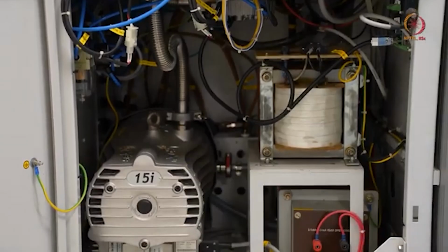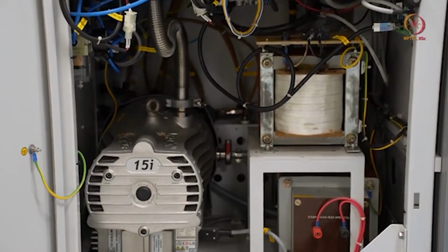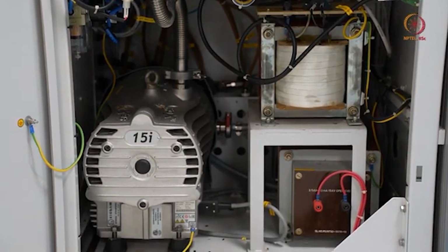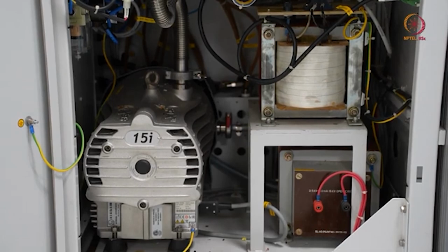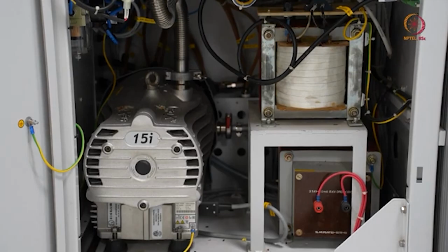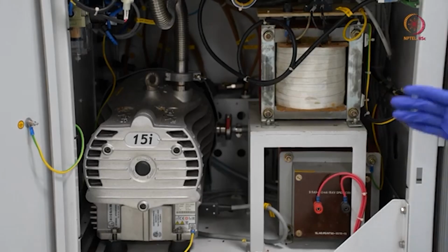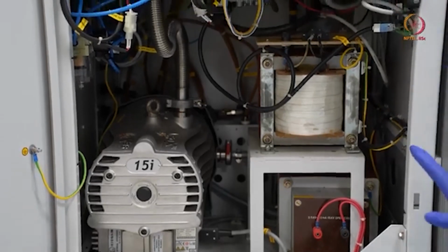When it creates vacuum directly from the chamber, it works as the roughing line, and when the turbomolecular pump takes over, that time this acts as a backing valve. So it helps the turbomolecular pump by creating a continuous pressure of 10^-4 in the remaining area, and this turbomolecular pump will create vacuum in the chamber.